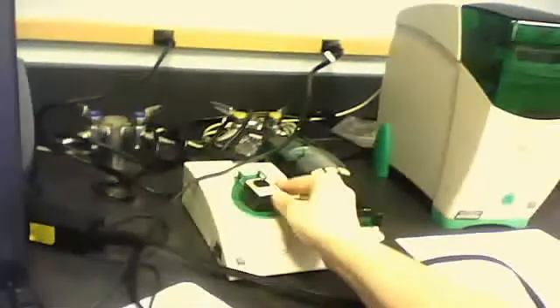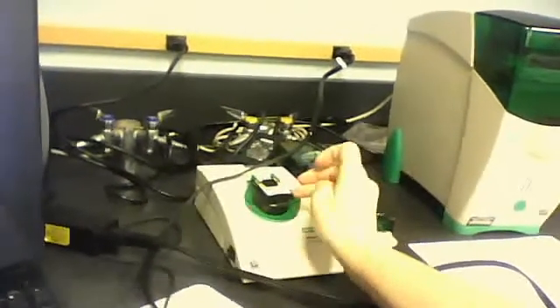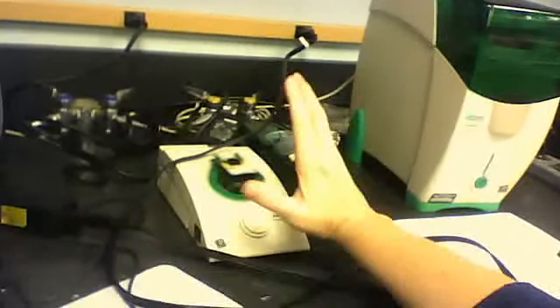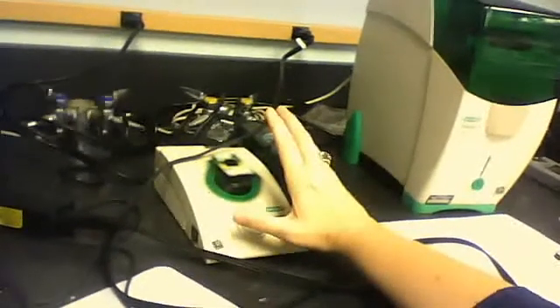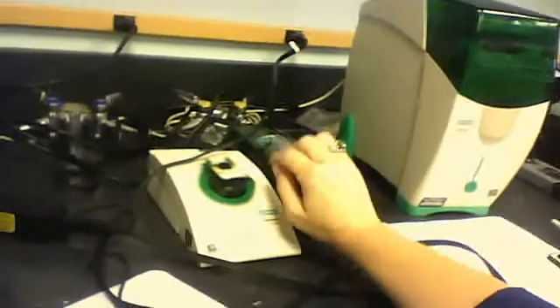Then once you're done with that, once you're done loading your sample, you want to put it into this unit right here. Let me get you a good shot of that. That is your mixing unit. And that's where you're going to place your chip onto the mixing unit like this until it clicks, push it back until it clicks, and then turn it on. It will run for 60 seconds. It's actually mixing the samples that you have loaded into there, and once it's done mixing, you're ready to place it into the machine, which is right here, and then you're ready to start your software.